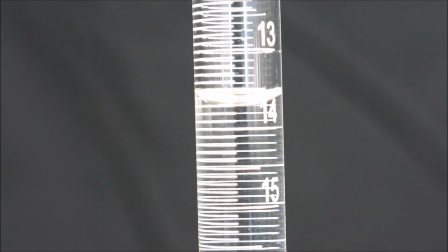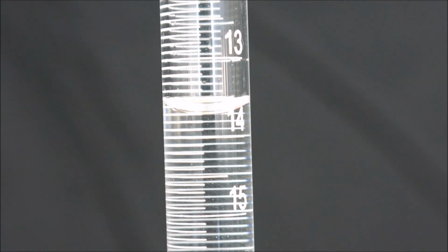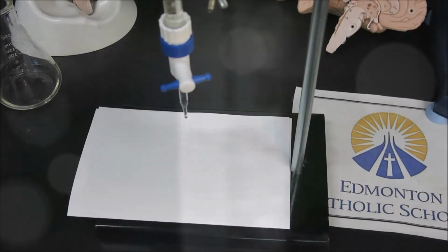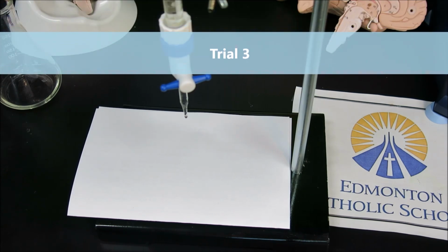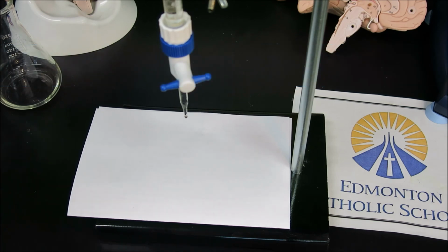So we will place our sample off to the side here, and we will once again zoom the camera in. And in this volume measurement we can see the 14 line at the bottom. And counting upwards from that, but going down by 0.1 each time, we have 13.9, 13.8, and then where the meniscus hits at 13.7. Given that second volume of 13.7 indicates an added volume of 5.3 milliliters, we can see that the first trial was definitely an overshoot, and our third trial now is going to aim for more of the 5 milliliter mark, as I added very quickly, and then slowing it down to the last addition of the 0.3 milliliters.